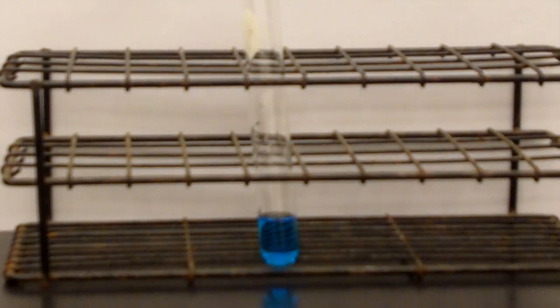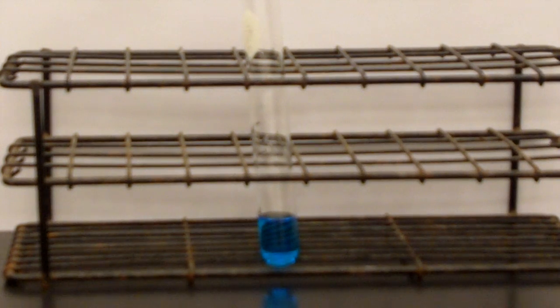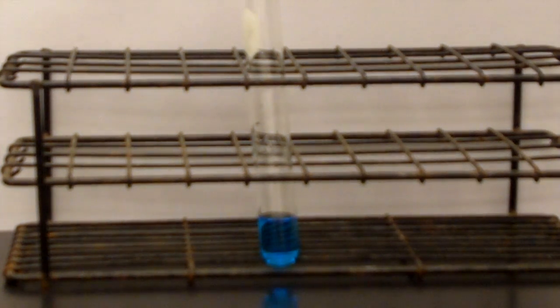Now we have copper sulfate, and we're adding sodium carbonate.